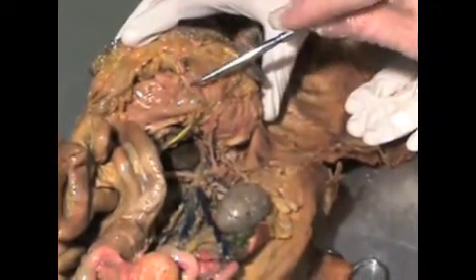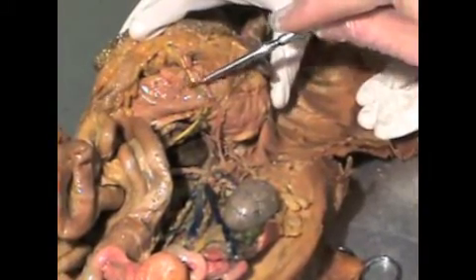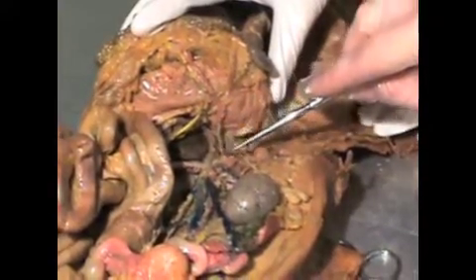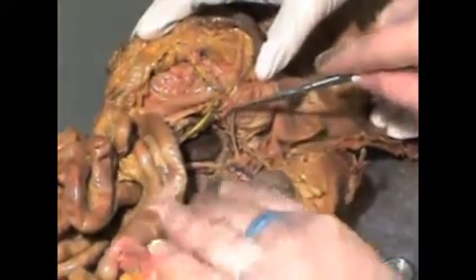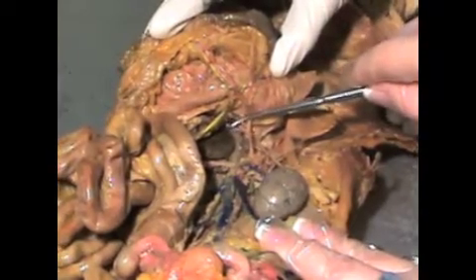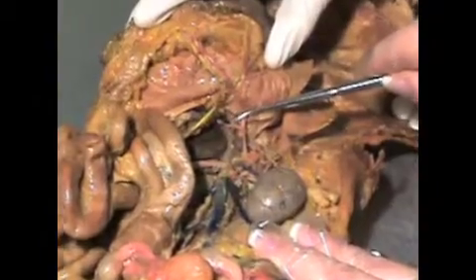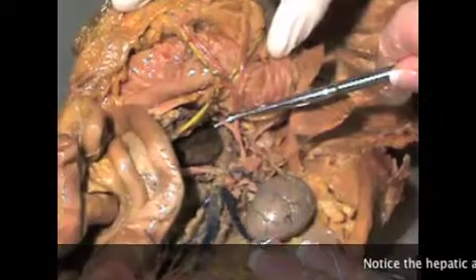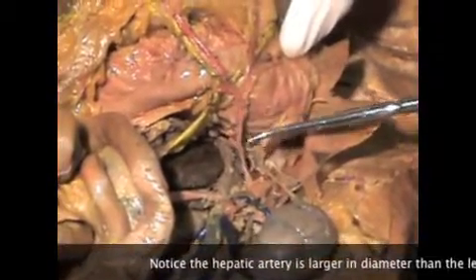A gastrosplenic vein lies alongside the splenic artery, and that's part of the portal circulation, so those vessels have been injected with yellow latex. The next branch off of the celiac trunk is the small left gastric artery, seen here. The left gastric artery serves the stomach. The branch that in this specimen lies just below the left gastric artery is the hepatic artery. The hepatic artery serves the liver.